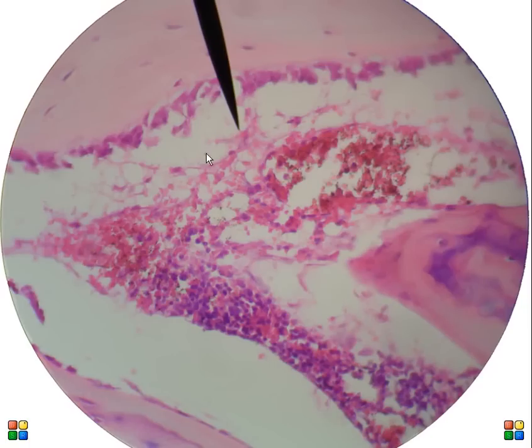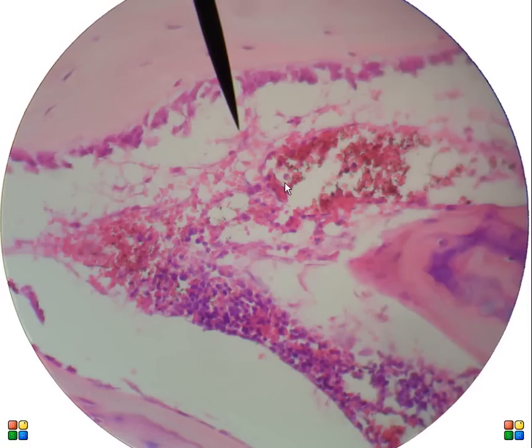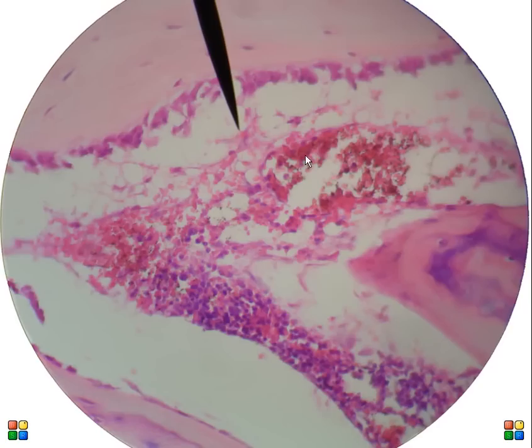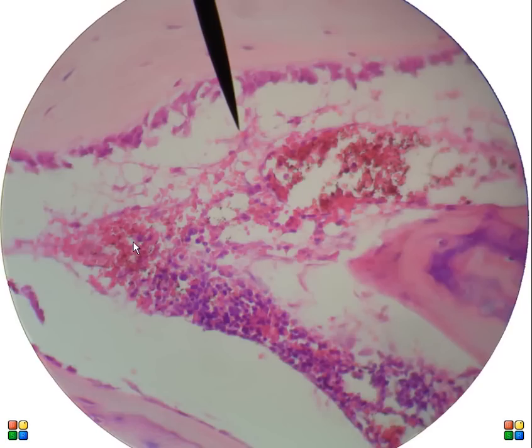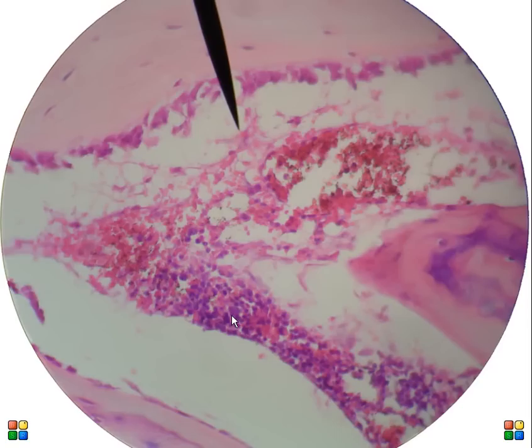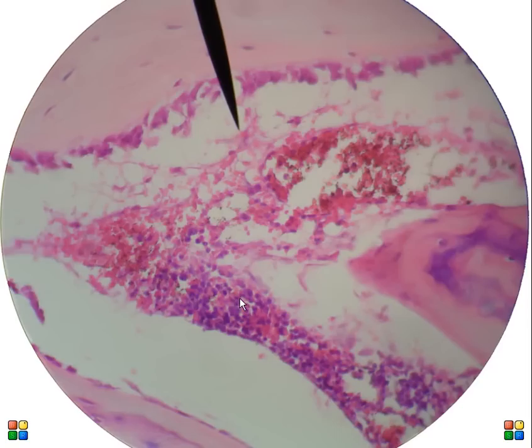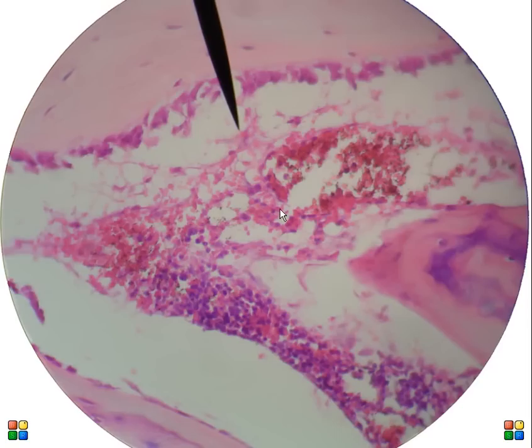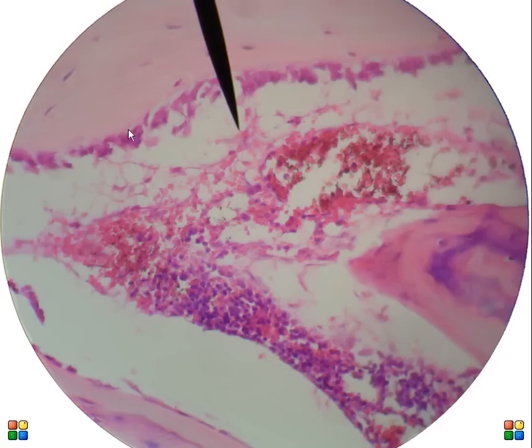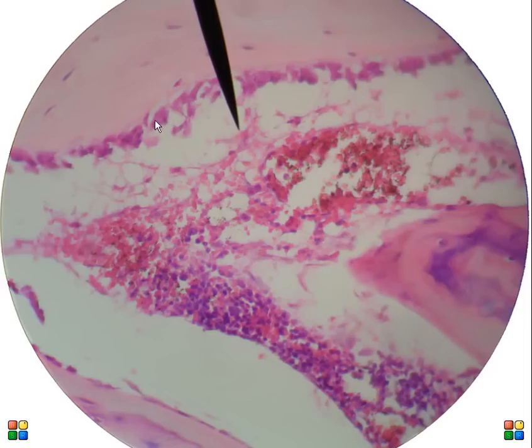Next slide, we have 450 times magnification of red bone marrow. You can see the reddish area — red blood cells developing over here too. These purplish cells are white blood cells developing. The other type of cell you'd see in here would be megakaryocytes, which give rise to platelets. This tissue lining would be the endosteum, by the way.